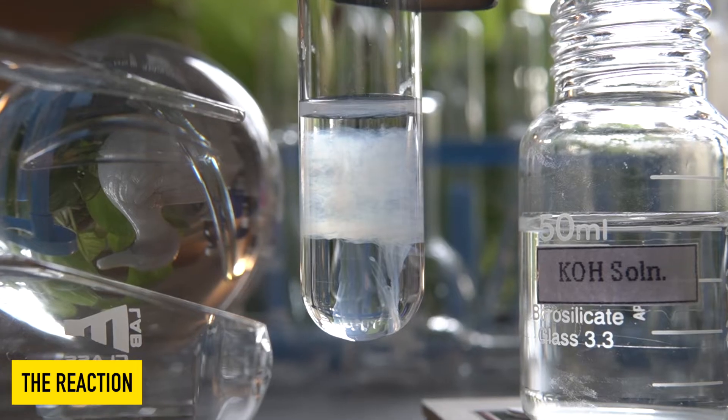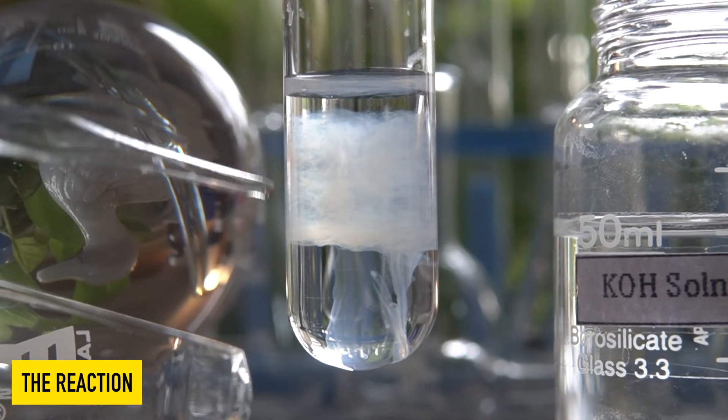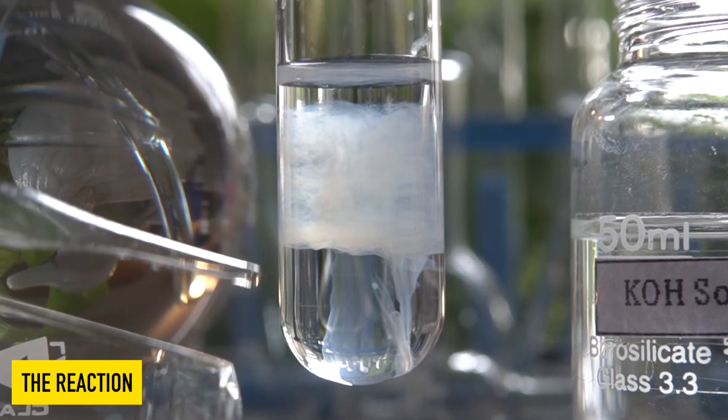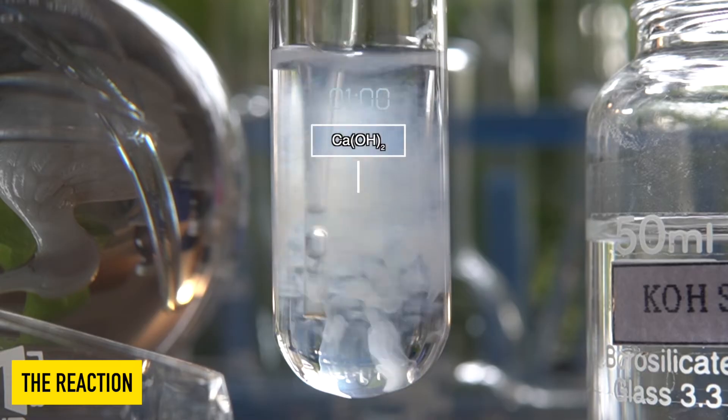The white insoluble precipitate that has formed inside the test tube is calcium hydroxide.